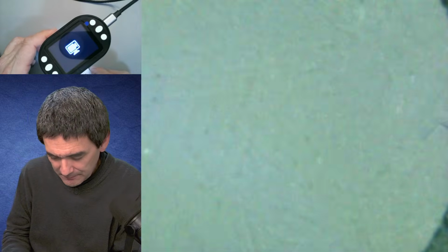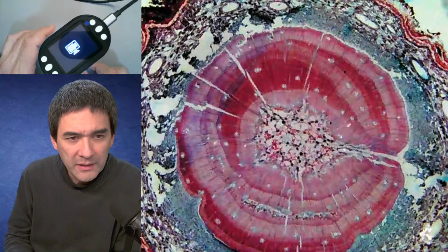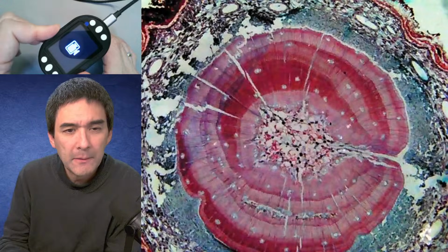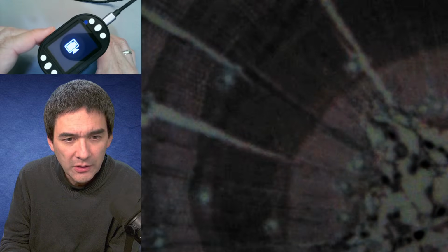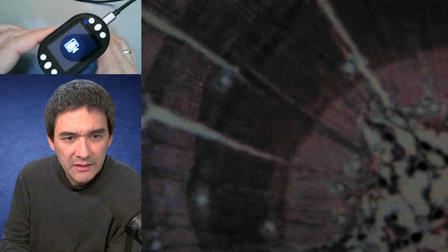But then again, I've been thinking, to what extent are these devices suitable or not suitable for hobby and amateur use? So again, over here, this seems to be a pine stem cross section. I'm turning this again. Let's increase the magnification. Okay. And again, over here, it's fairly dark. If I turn up the light a little bit more, I'm kind of worried that it's going to start disconnecting again.